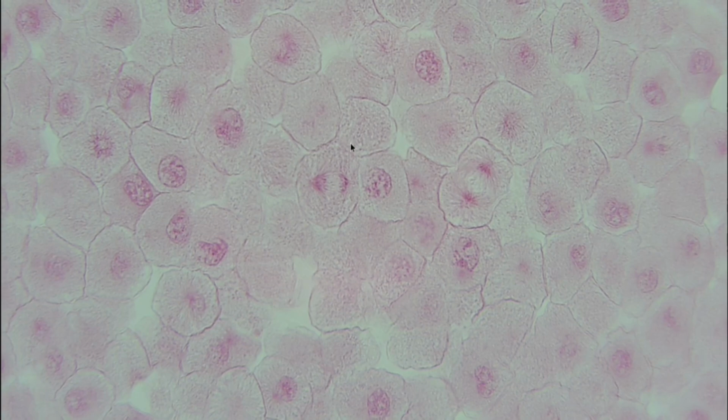And so here we can tell this is anaphase because it's just one big circle. But right here we've started to enter into telophase because we have this divot, right? And we can see it on both sides, this little divot, and it's going to kind of pinch off from each other and form two daughter cells.